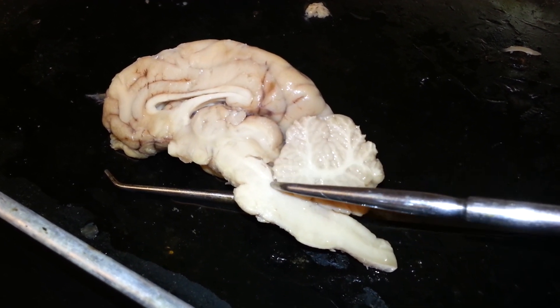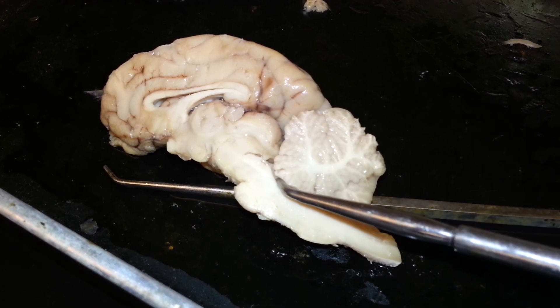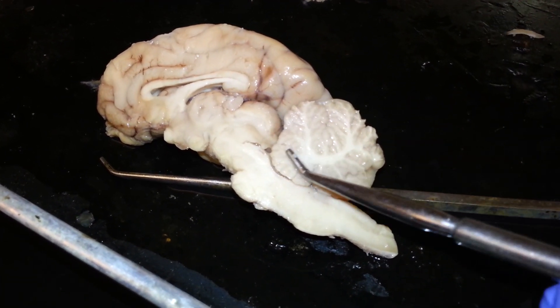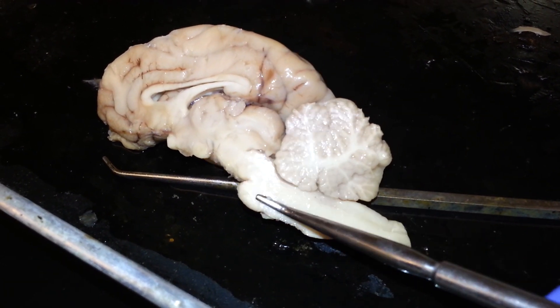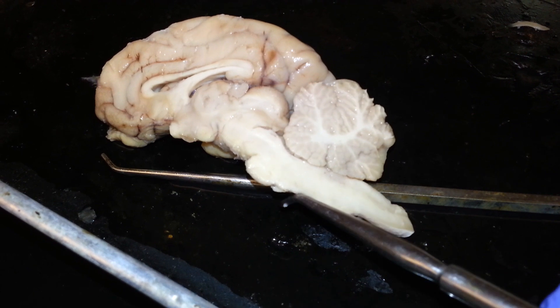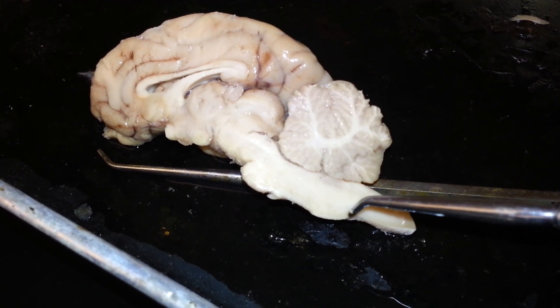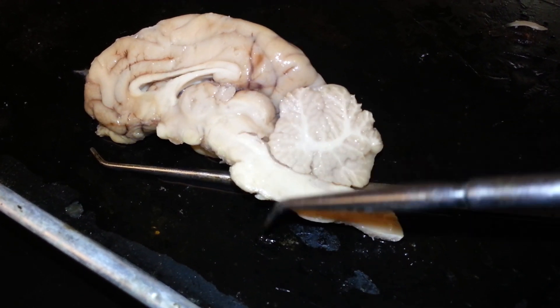Tracing that up, we have the aqueduct of Silvius right here. Below the aqueduct of Silvius, we have this second bump, which is the pons. So here we have the spinal cord — first bump is the medulla oblongata, second bump is the pons.